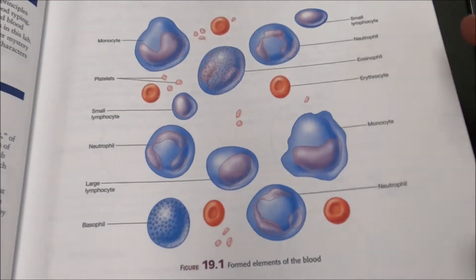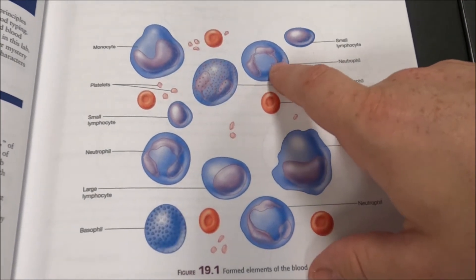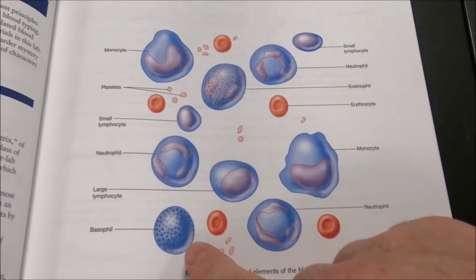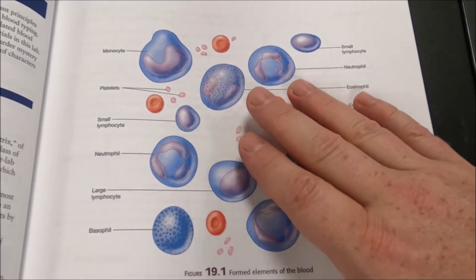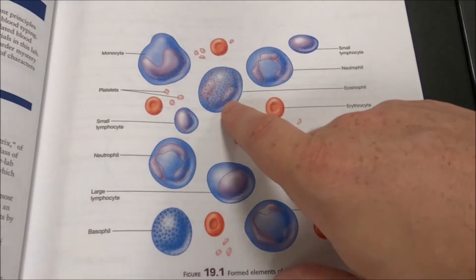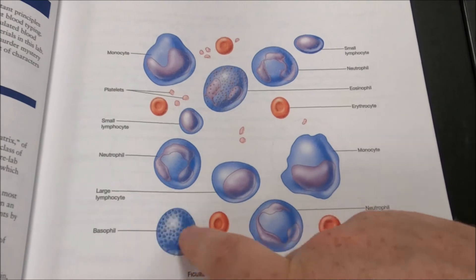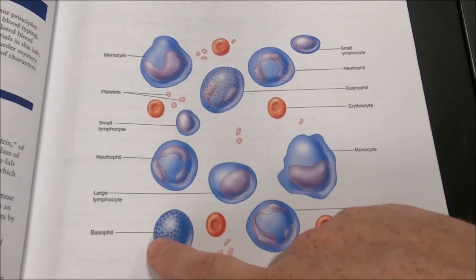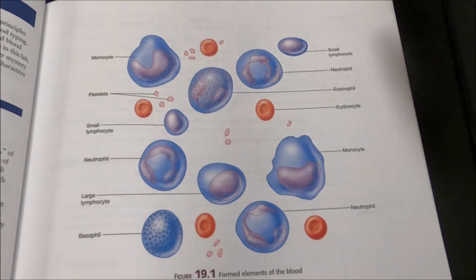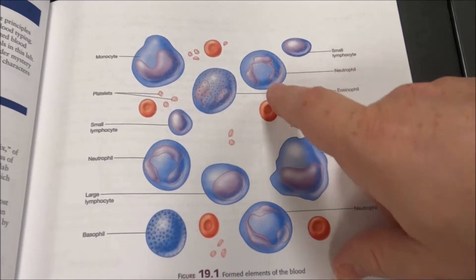It's quite fascinating and very important. Our granulocytes — the neutrophils, the eosinophils, and the basophils — the reason they have these names tends to be because of the types of dyes used to stain them. Eosin is used to stain eosinophils, and the stain used for basophils is a basic stain — they have an affinity for specific stain types. What you want to look for in a neutrophil is this multi-lobed nucleus.